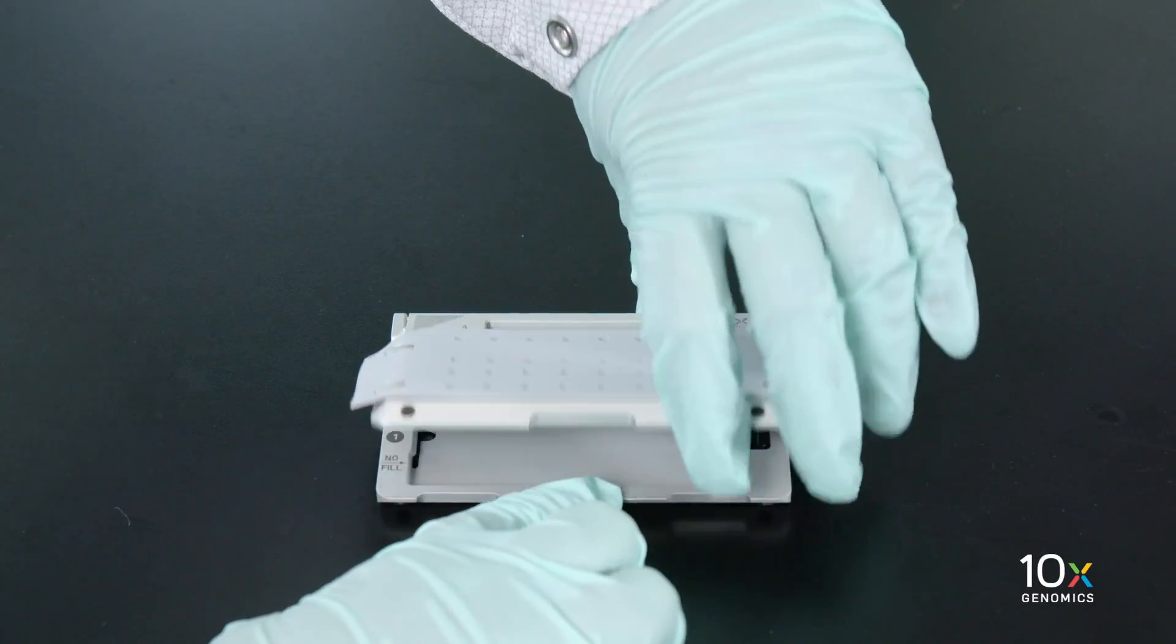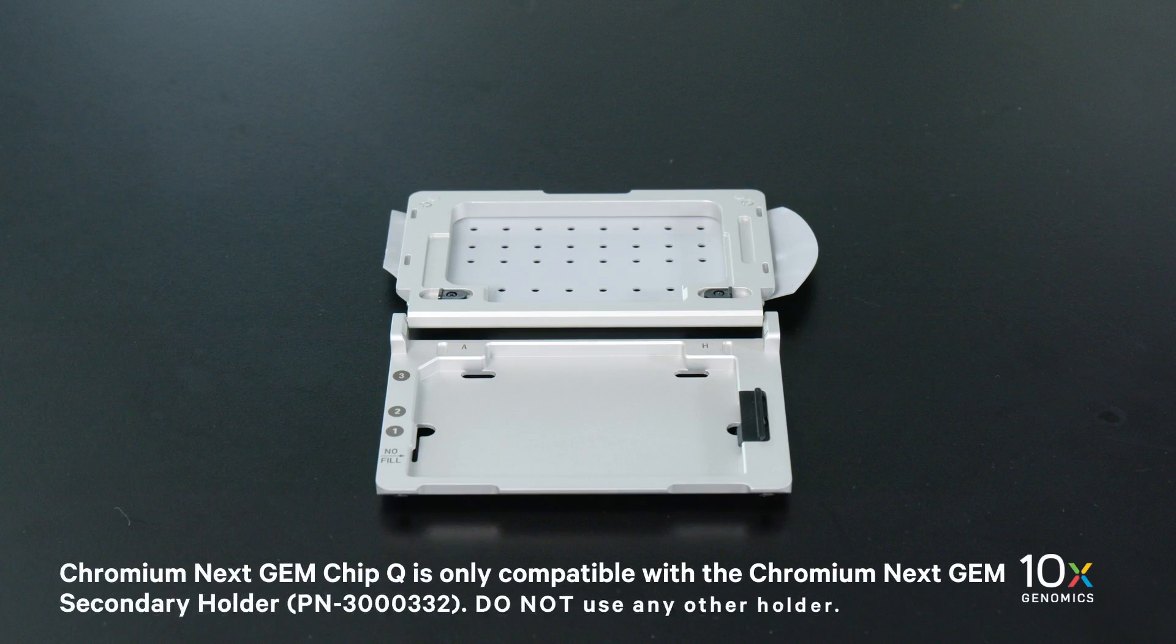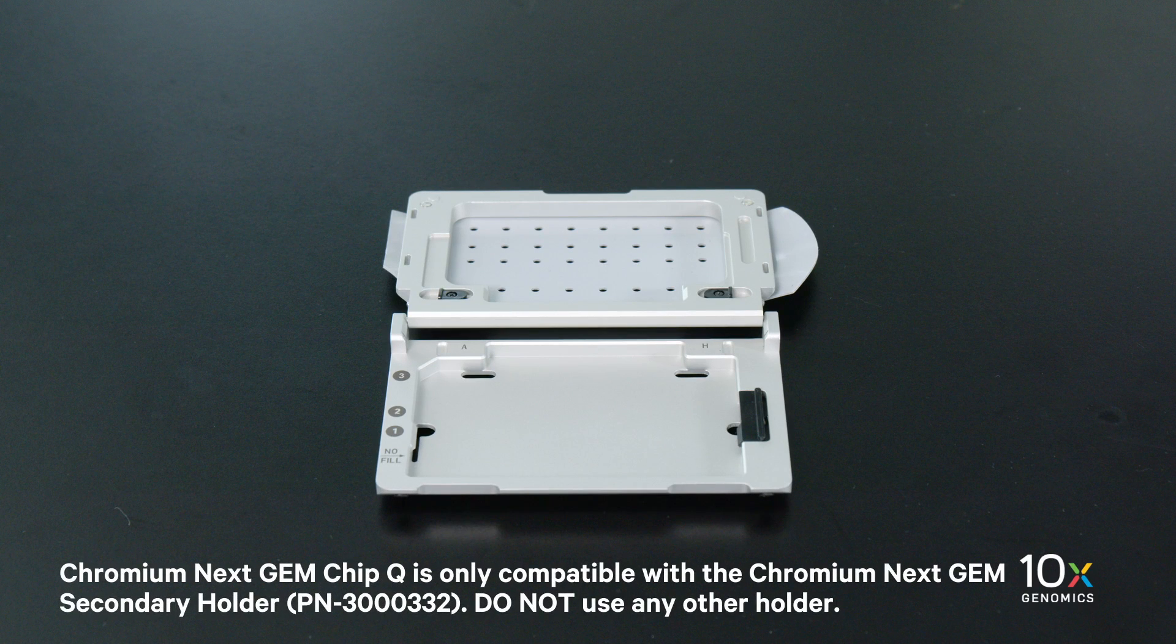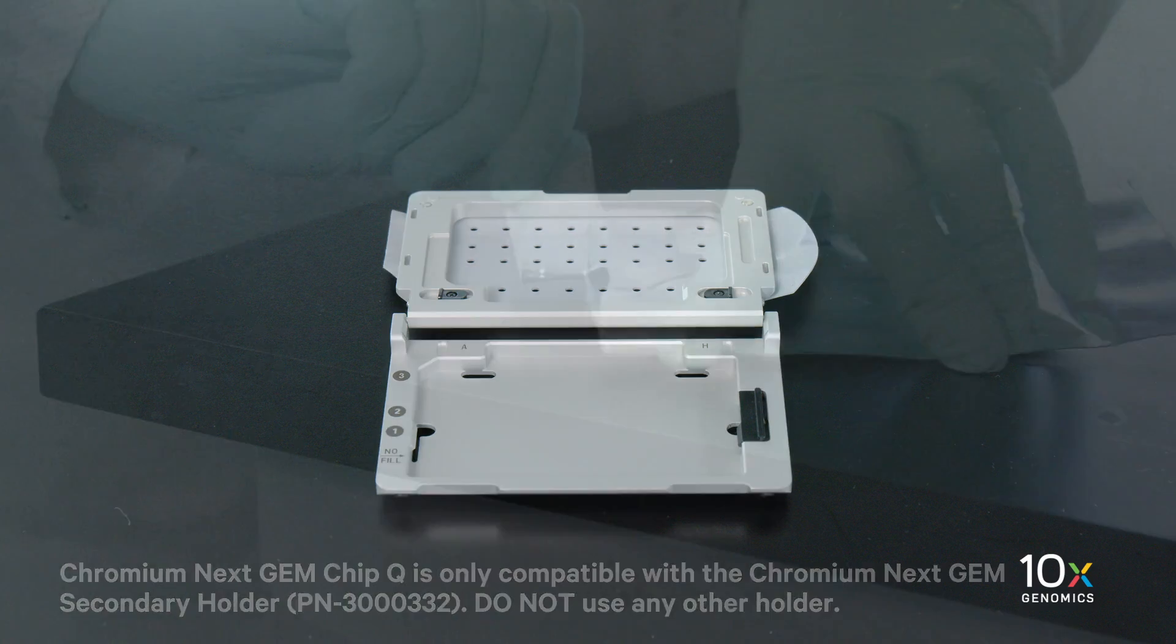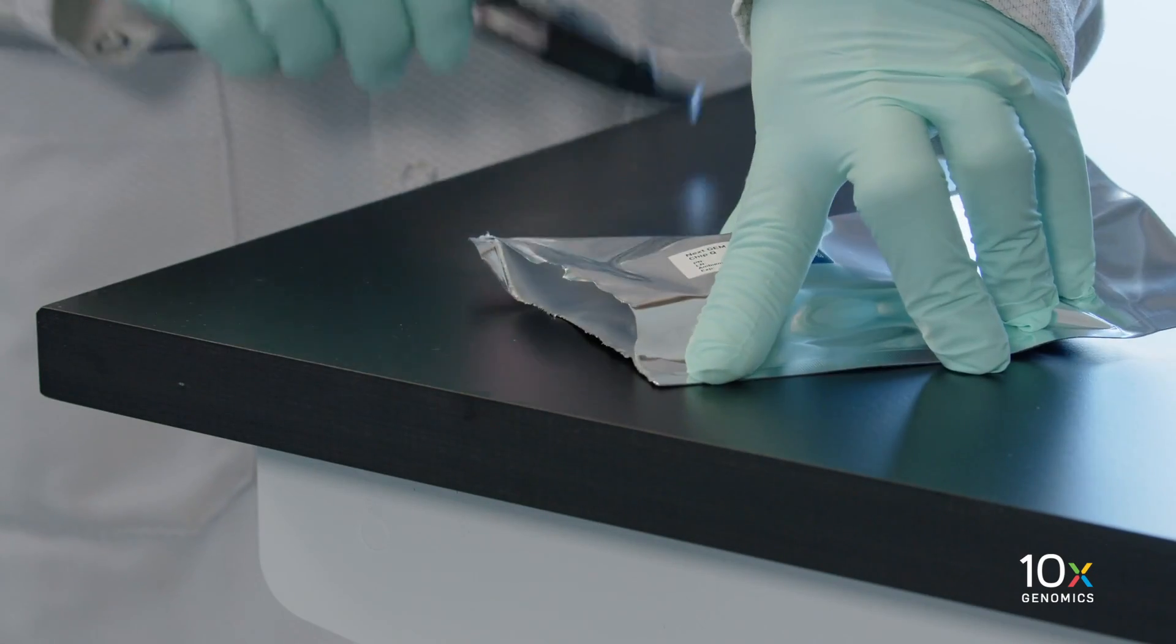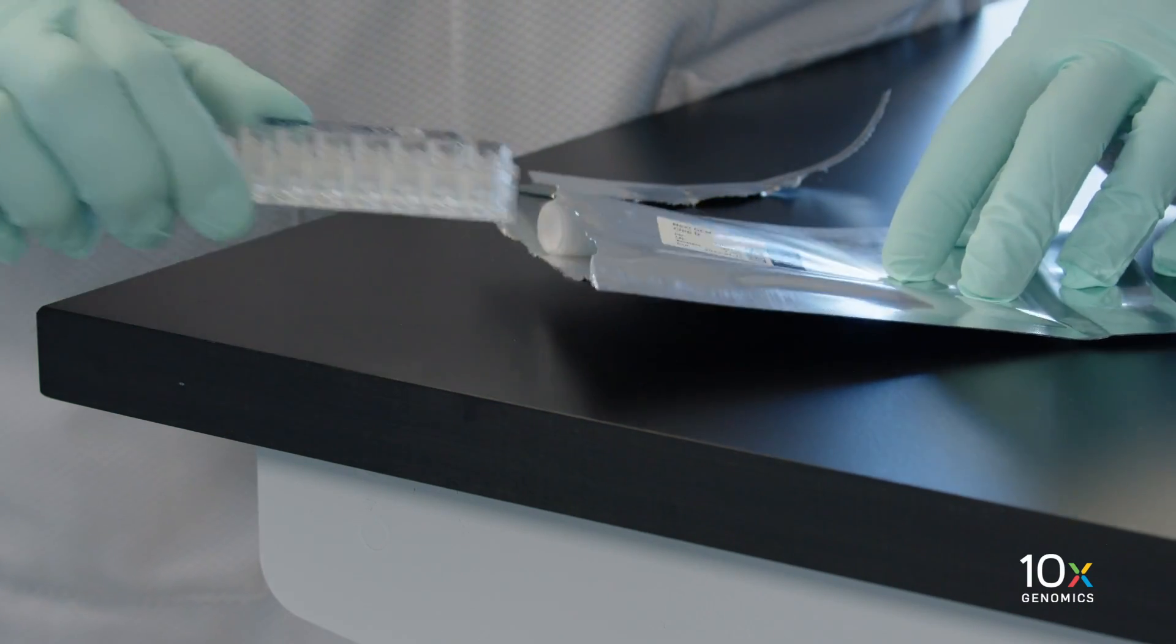Open the Chromium Next GEM secondary holder with the gasket attached. Chromium Next GEM Chip Q is only compatible with the Chromium Next GEM secondary holder. Do not use any other holder. Remove the chip from the sealed bag. After removing the chip from the sealed bag, use the chip within 24 hours.